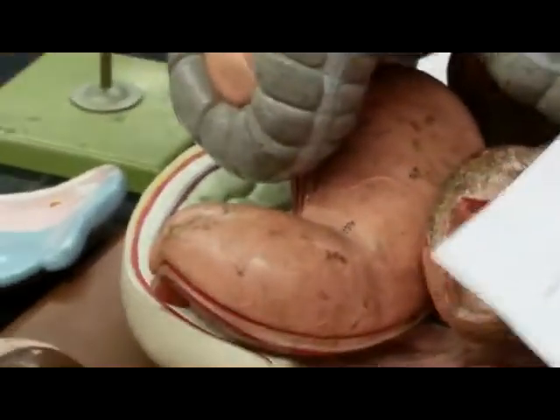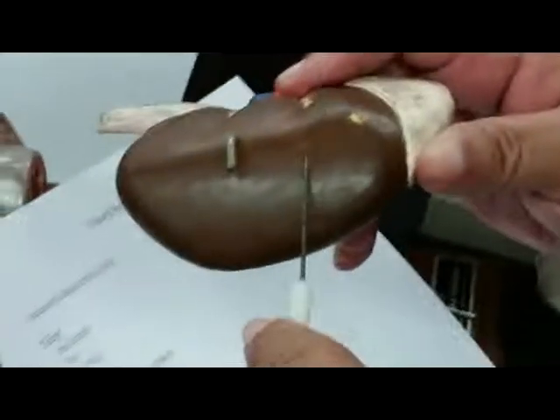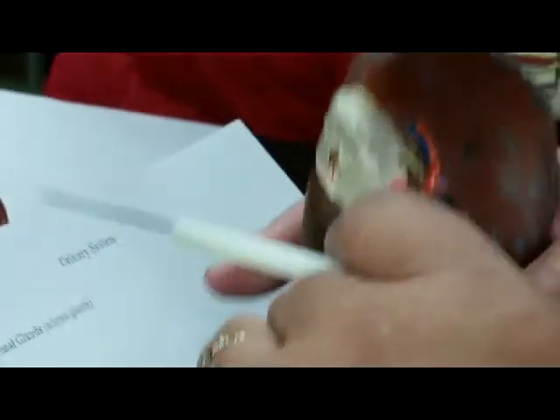So we're going to look at the kidney, and everything pertaining to the kidney is renal. Renal capsule, the covering of the kidney. The indentation would be the hilus or the hilum, and that's where the blood vessels are leaving and entering.